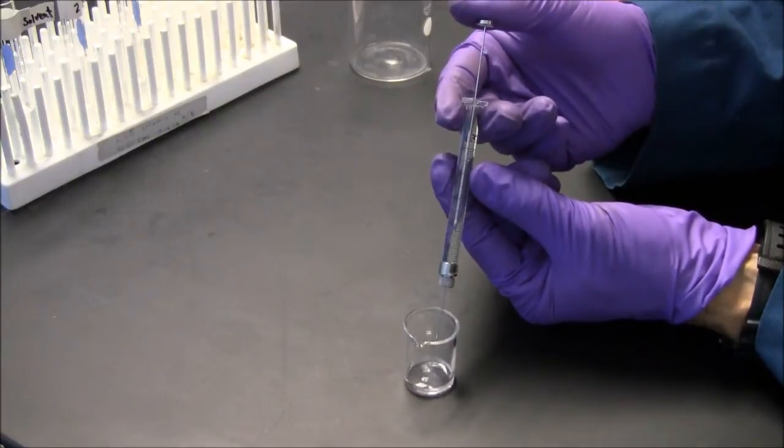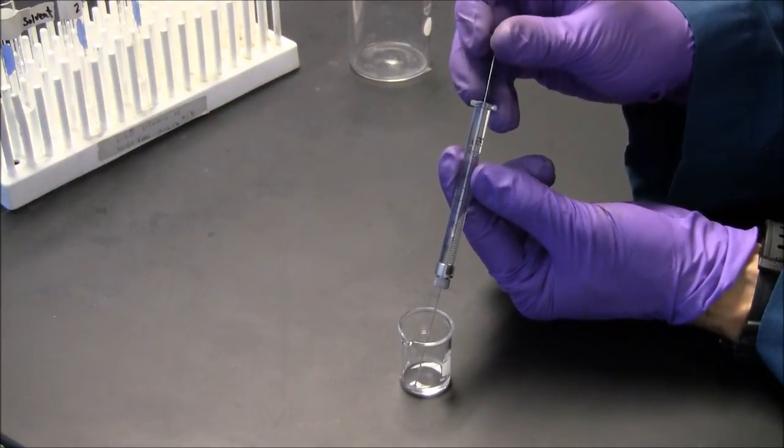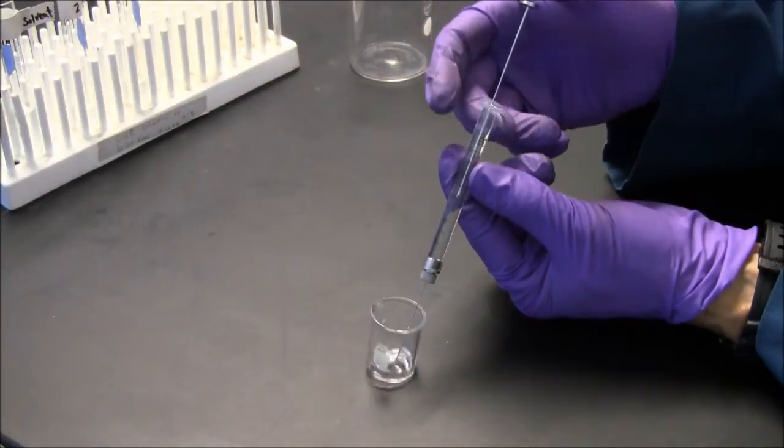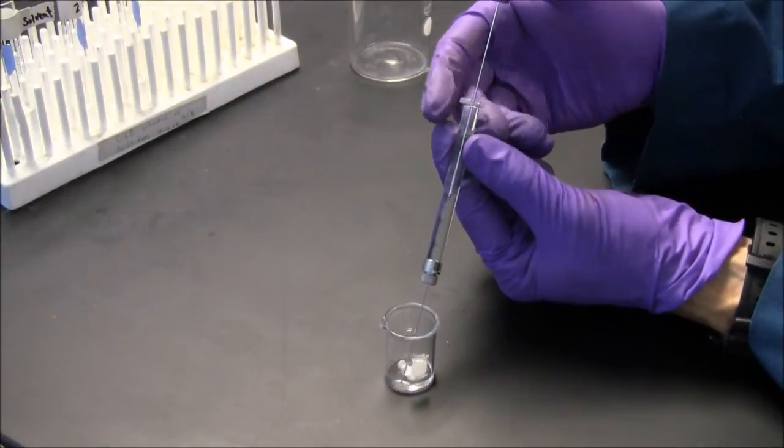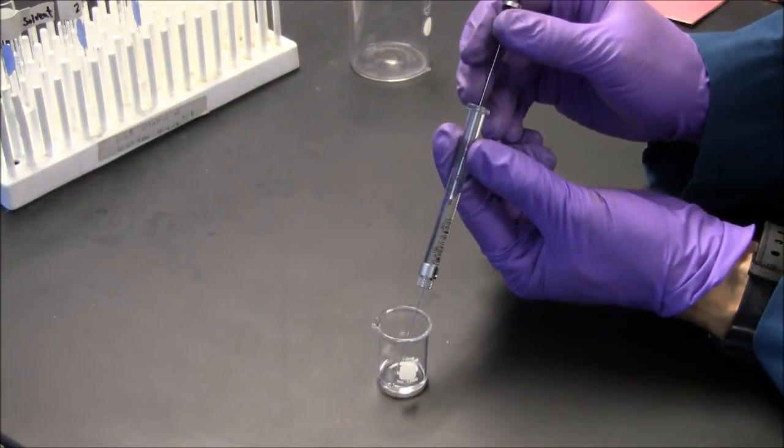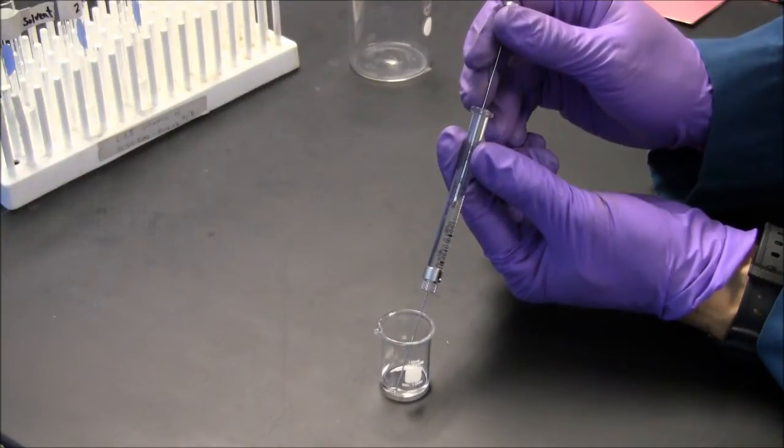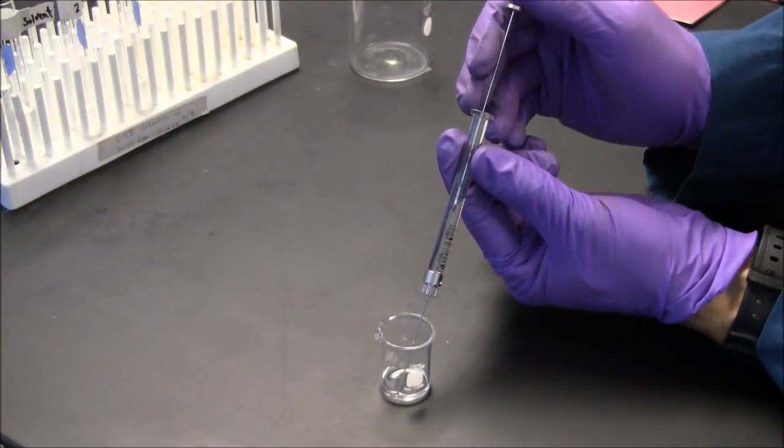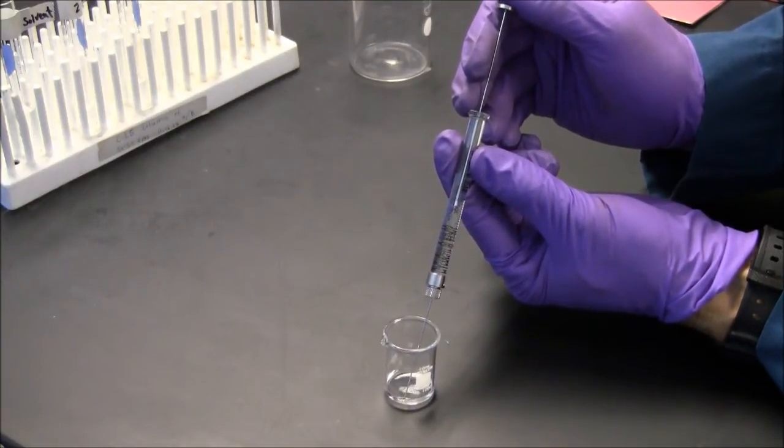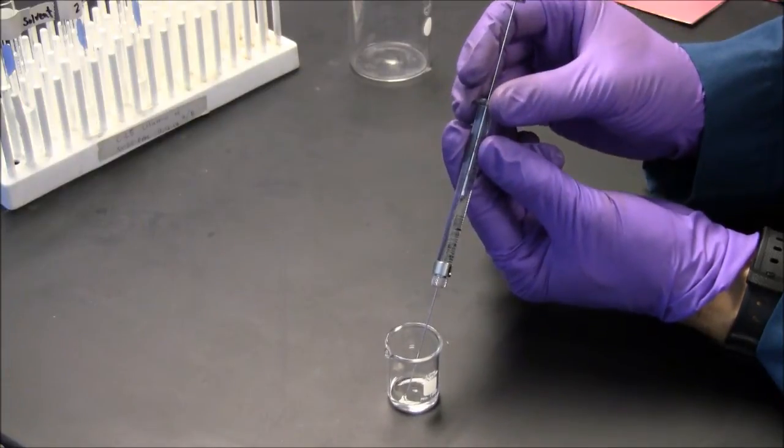Still, yeah it's pretty good now. One more time should be it. All right, so there's a minuscule air bubble I can compensate for that. I have to have good eyes to be able to see when I'm on the line. So right now I have 30 microliters in the syringe.